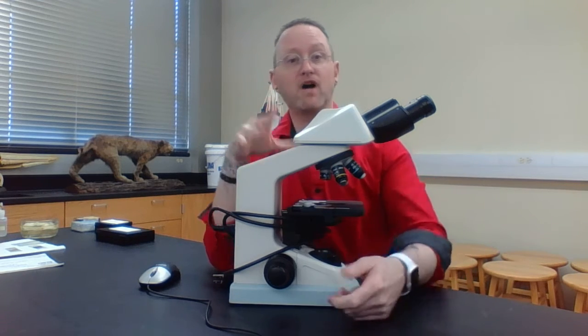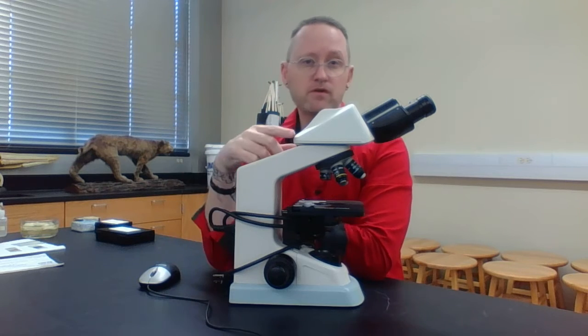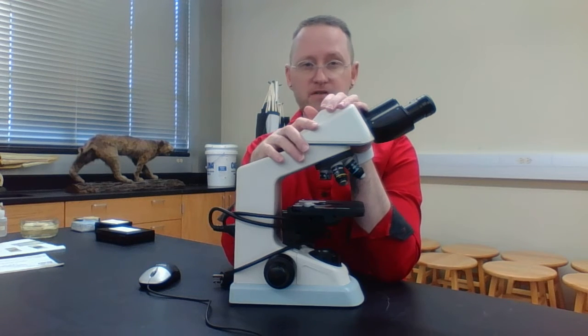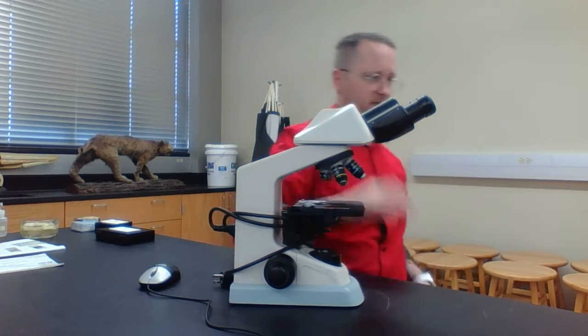So that's why we use other types of microscopes like confocal microscopes, or an electron microscope, because again, we can actually increase the resolution. We can actually distinguish between two objects instead of being one object. So again, magnification and resolution are two important properties or characteristics of all microscopes. And typically with the compound light microscope, the maximum amount of magnification that we can actually get is probably about 1,000. We'll talk about that in a couple of minutes.